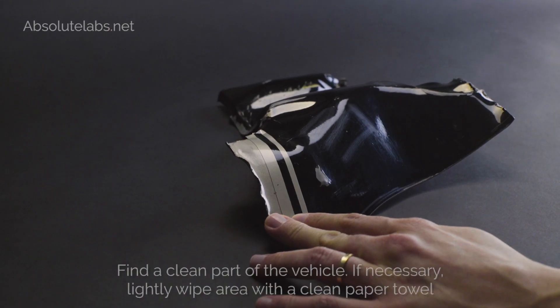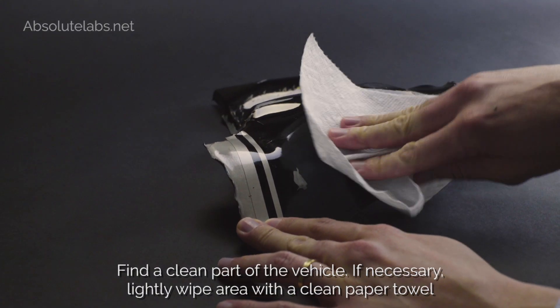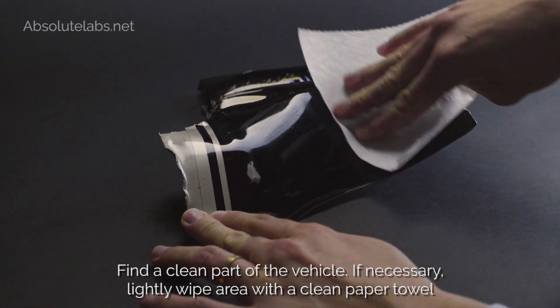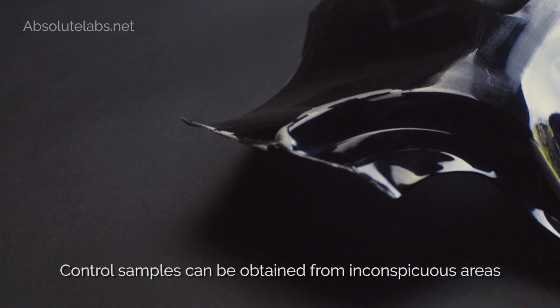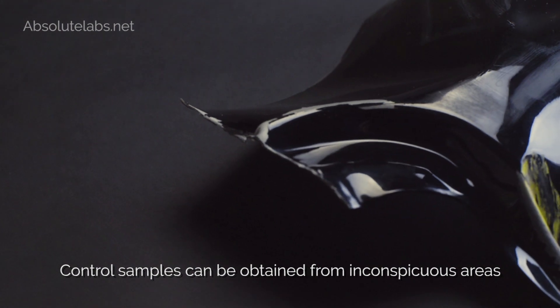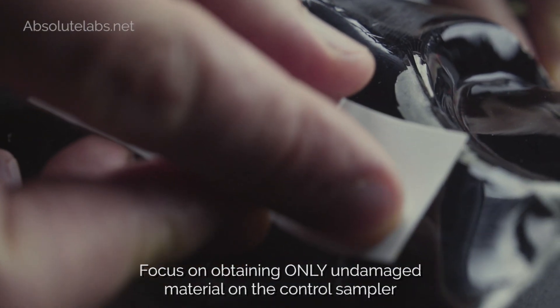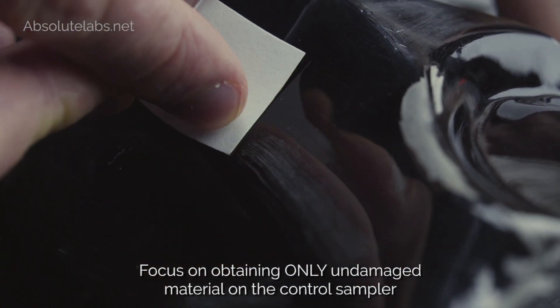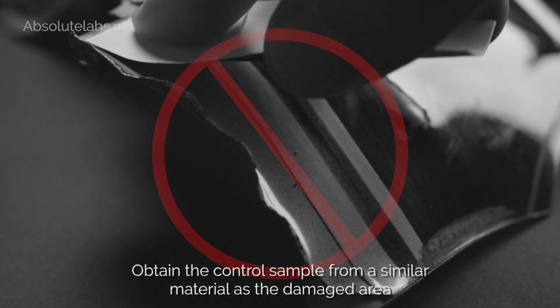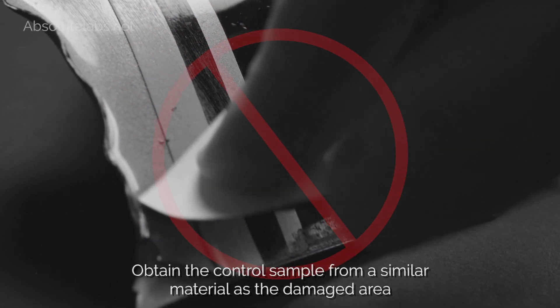Tips: Find a clean part of the vehicle. If necessary, lightly wipe the area with a clean paper towel. Control samples can be obtained from inconspicuous areas. Focus on obtaining only undamaged material on the control sampler. Obtain the control sample from a similar material as the damaged area.